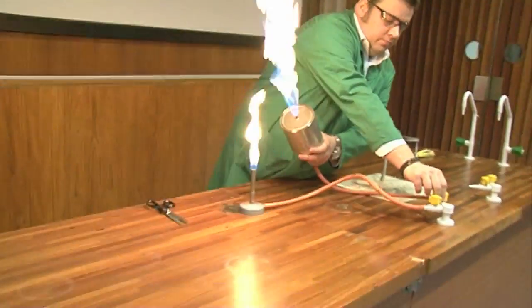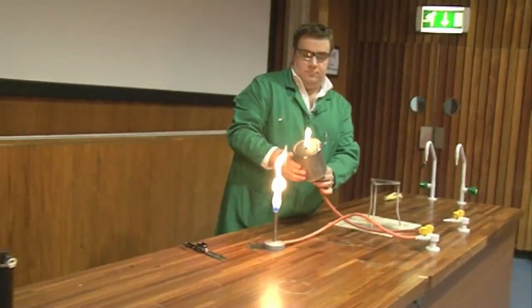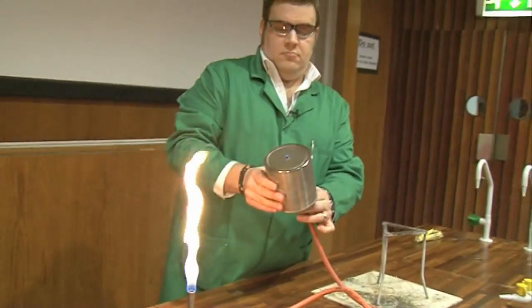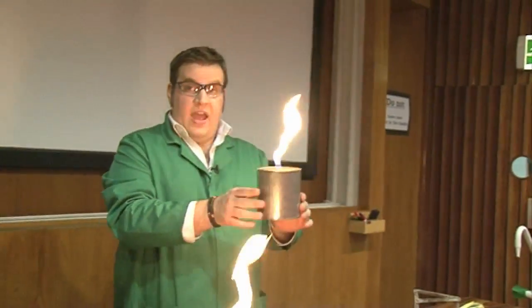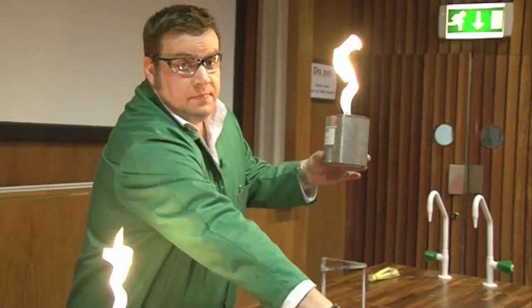And then, when it's completed, I'm going to set fire to the top. So now I have a reservoir of gas inside my can, which is burning in the atmosphere.